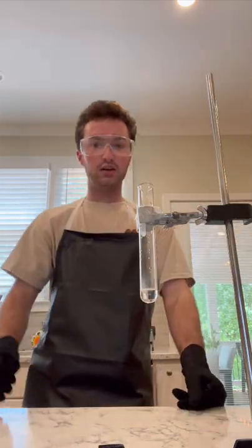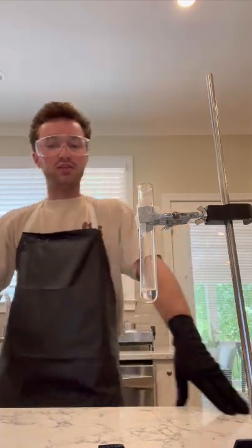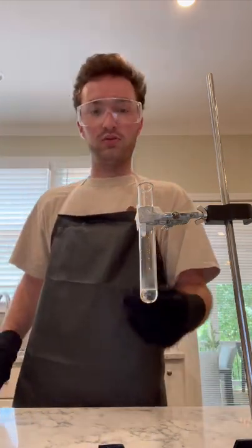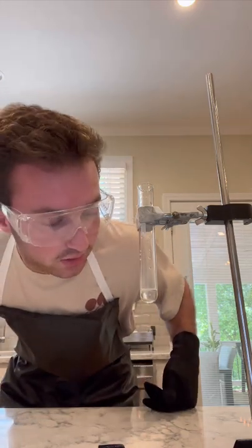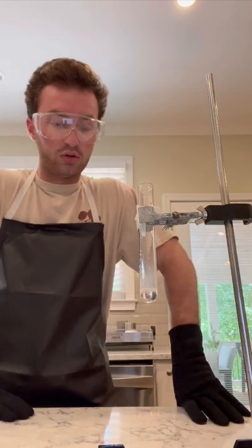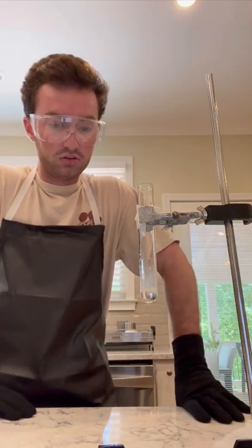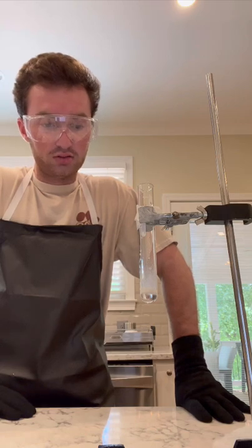Did take a minute to get going, but actually it's not fully complete yet, so to speak, but it's getting going right now. I'm not sure if you can tell from the video, but you can see the glass is starting to fog up. The aluminum foil is starting to bubble in the HCl as we speak right now. You can actually hear the bubbling. I'm gonna be quiet for a sec, see if you can hear it. And now we're really getting going.